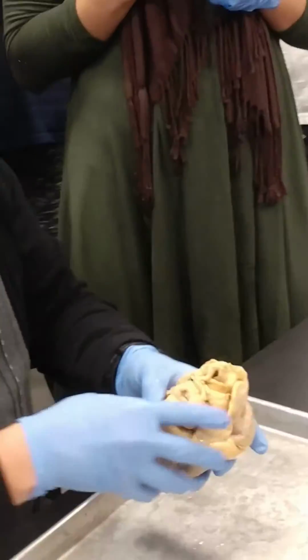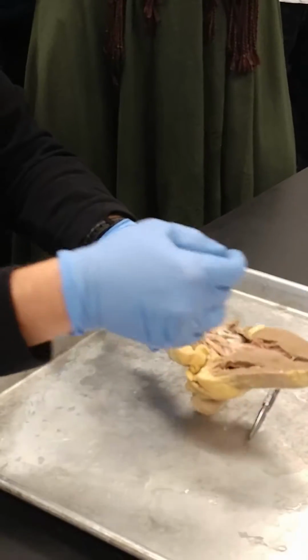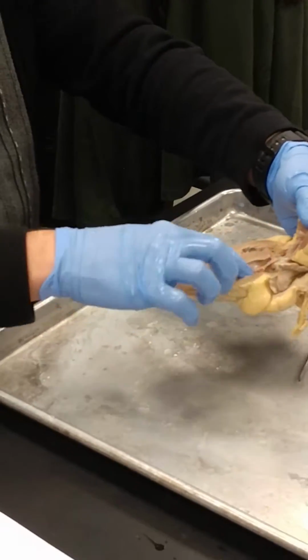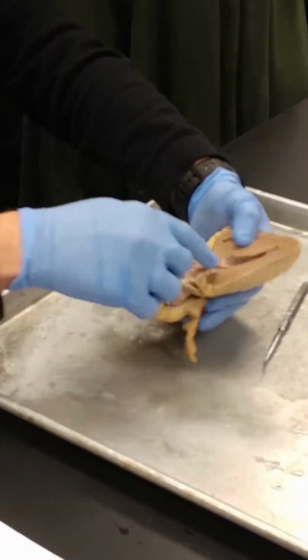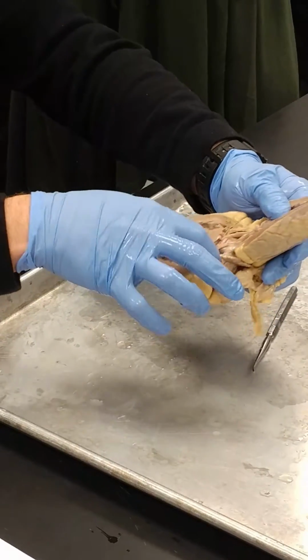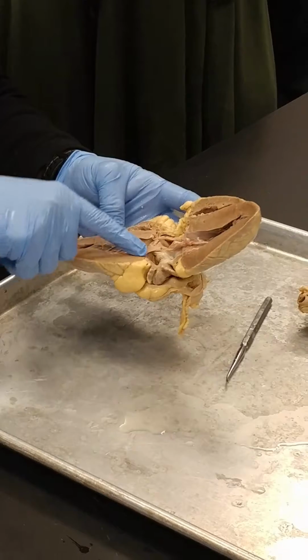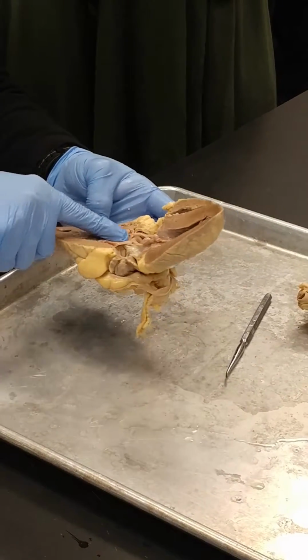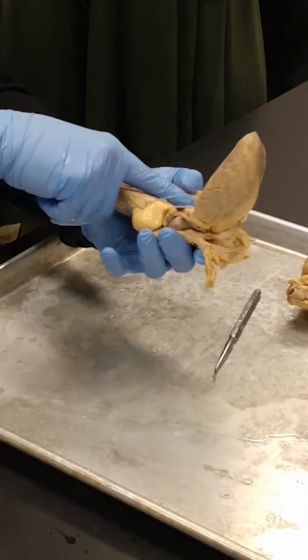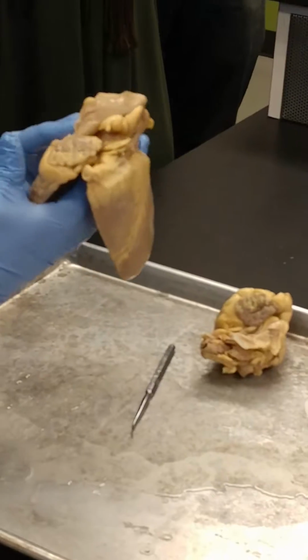So, which leads us to the next one, which is the aorta. So the aorta is coming off the left ventricle. If we look at this, this is the left ventricle, that's the left ventricle. This is the left atrium up above, okay, left atrium up above. So what happens when the left ventricle contracts, it's not going to send blood back in the other direction, it's going to send blood up in this direction. So this hole right there, that's going to be the hole for the aorta.